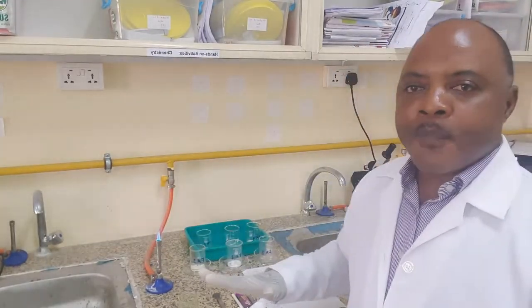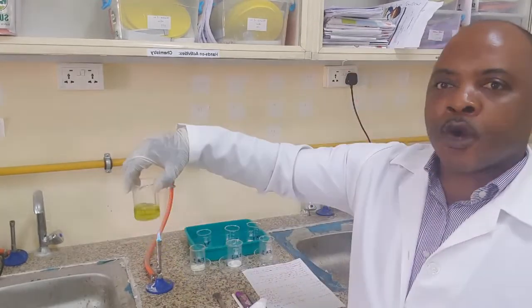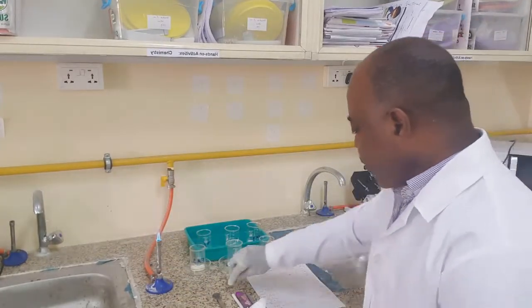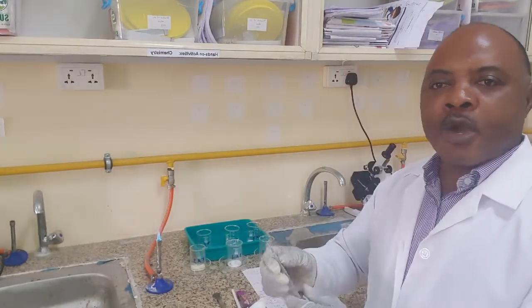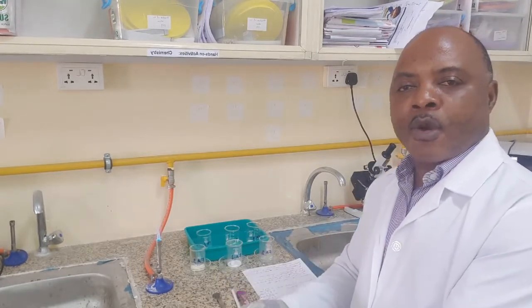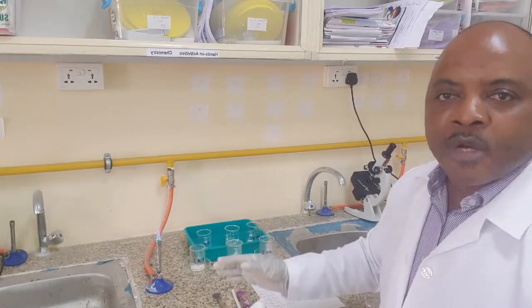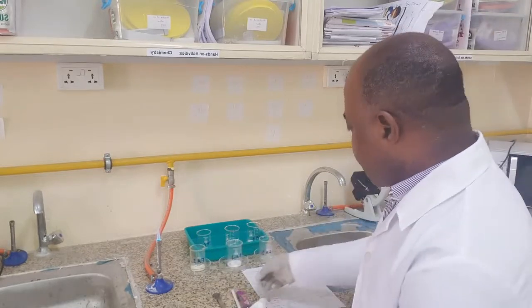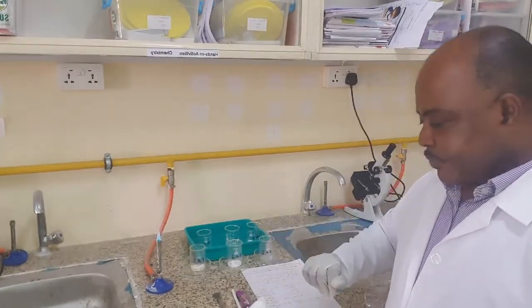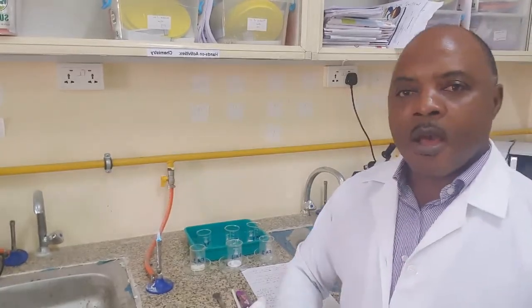In the lab, during the exam, you are provided with everything. Here we have concentrated hydrochloric acid that we use in cleaning the nichrome wire. The nichrome wire is provided because it is a metal that does not react. So we need to clean it using the concentrated hydrochloric acid, to ensure that the reaction of one salt and the other one does not disturb the color of the flame. You are also provided with the Bunsen burner. Now, the first thing you do in this type of test is you need to wear your goggles.